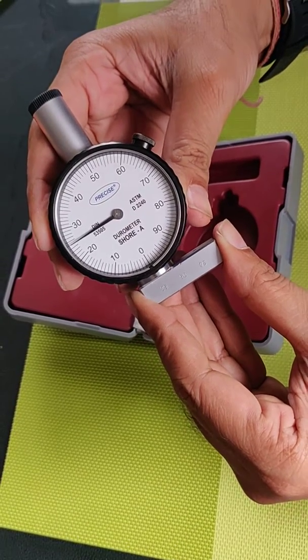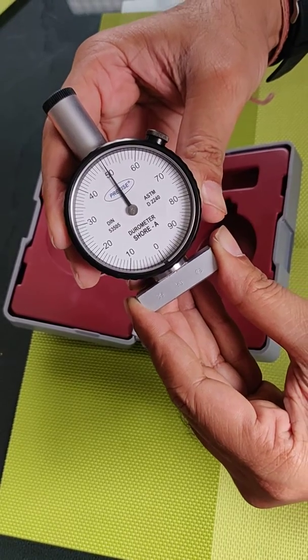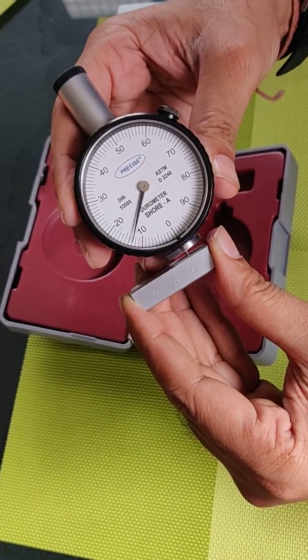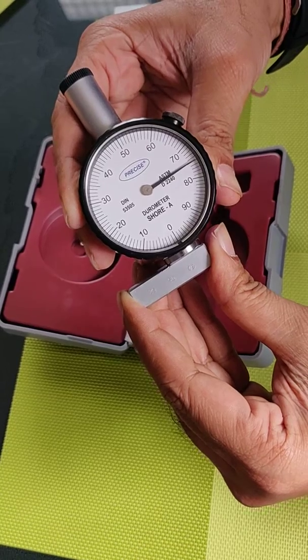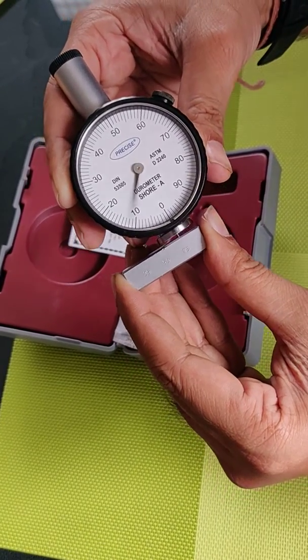For 25 it's showing 25. For 50 it's showing 50. For 75 it is showing 75. So it means this instrument is okay and calibrated. Thank you so much.